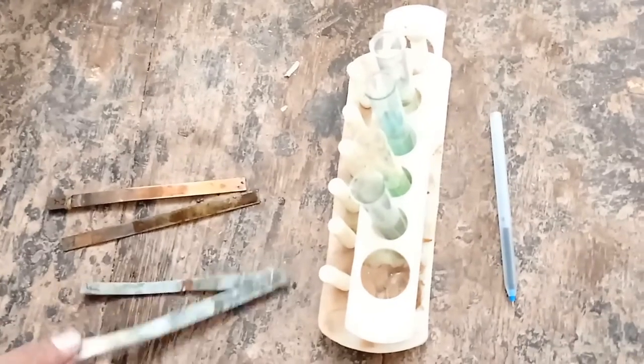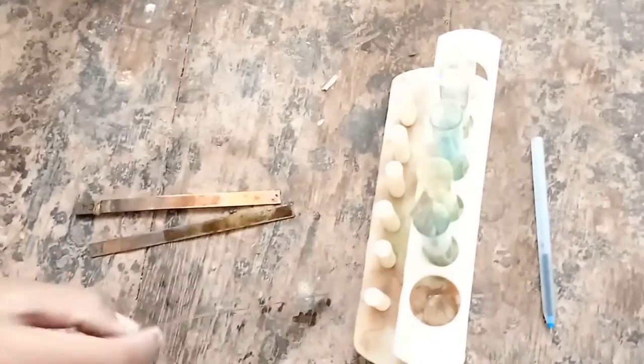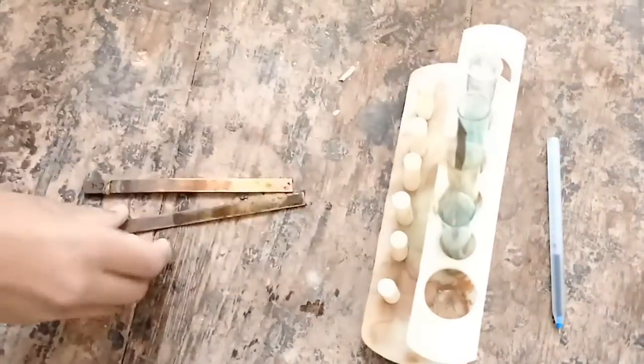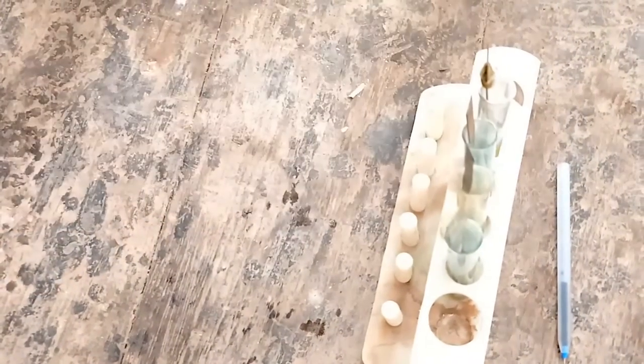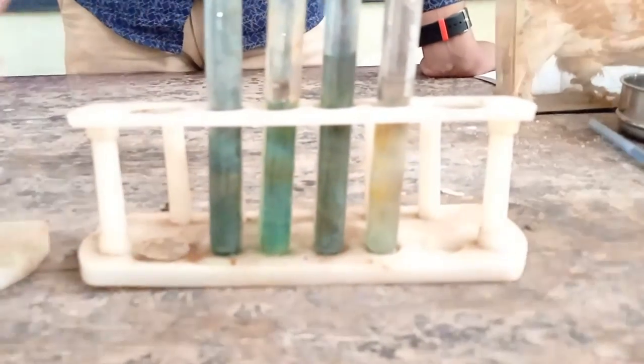Now, we are putting strips in Copper Sulphate. After some time, there is no changes occur in each test tube.